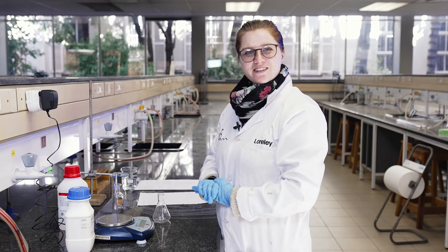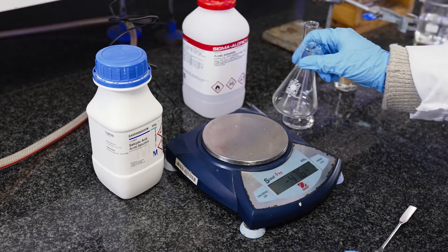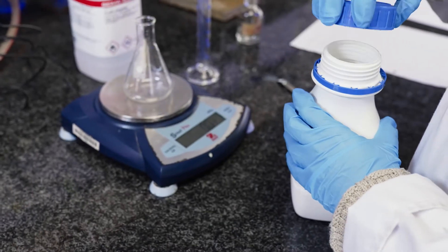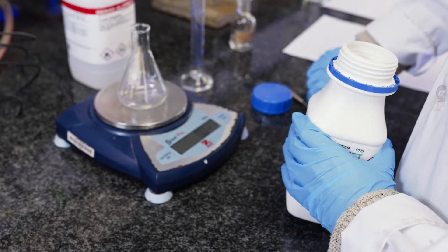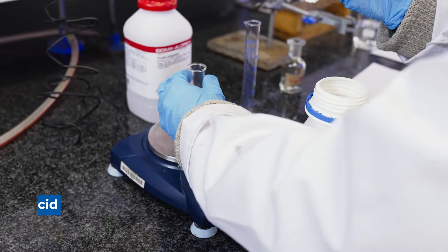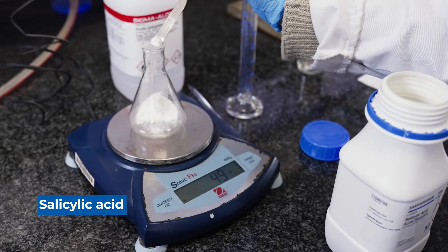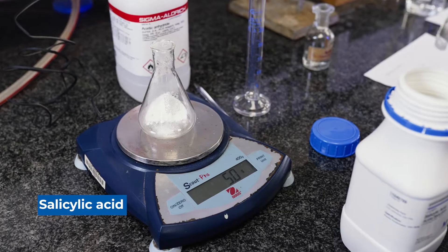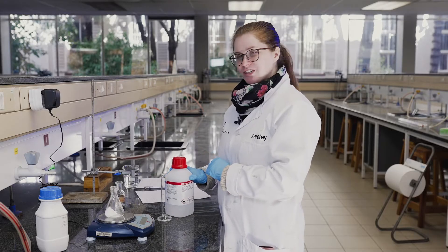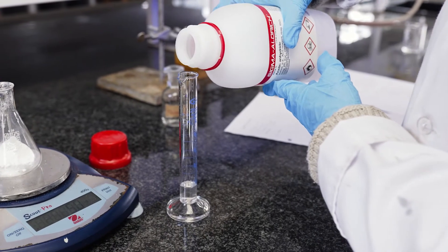We're going to start this experiment by weighing our salicylic acid. Now we're going to measure seven milliliters of acetic anhydride in a measuring cylinder.